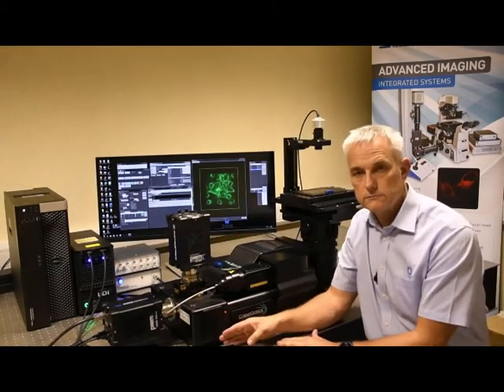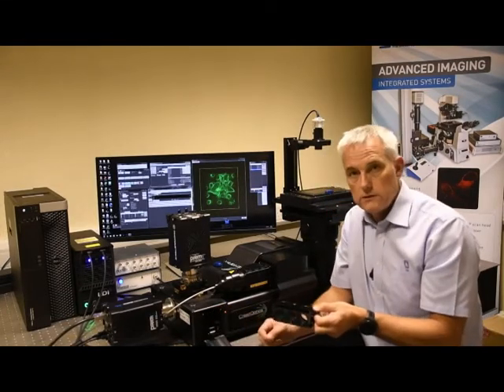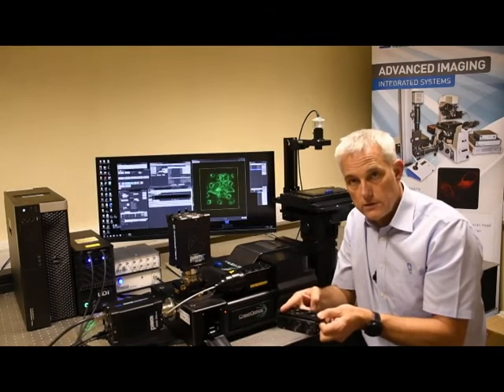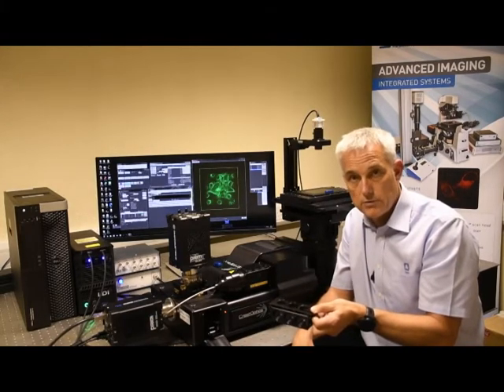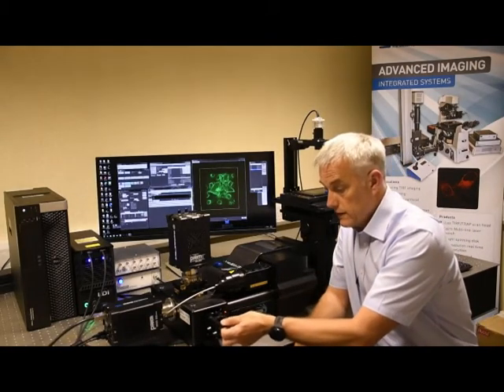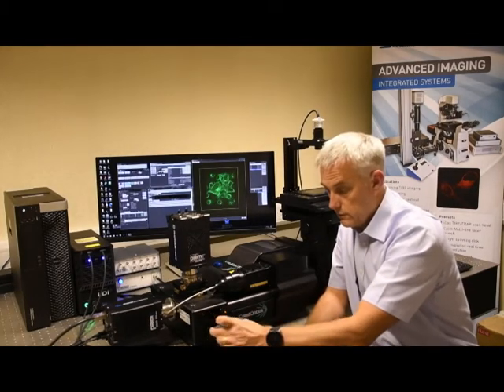With a two-camera configuration, to activate the second camera you make use of a filter slider that fits in the side here. This filter slider allows up to three different configurations to be fitted at one time. For instance, you could have a straight-through position, a 100% mirror in another position to effectively act as a port switcher, and in a third position a chromatic separation so you can simultaneously record on two channels. In each of the positions, there's provision for emission filters, and for added flexibility we can add filter wheels to each of the emission ports to provide full control over wavelength selection.